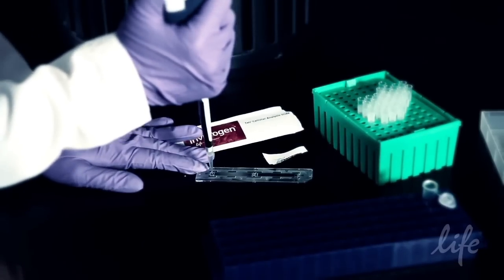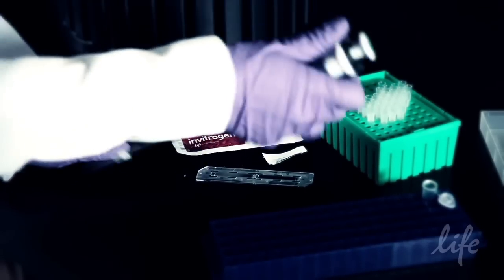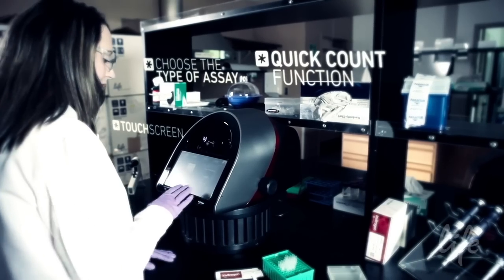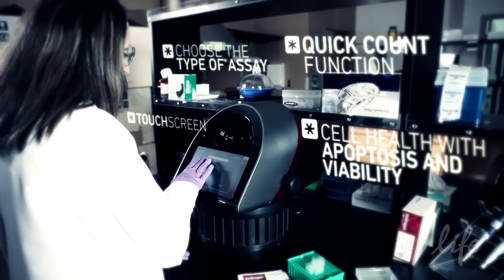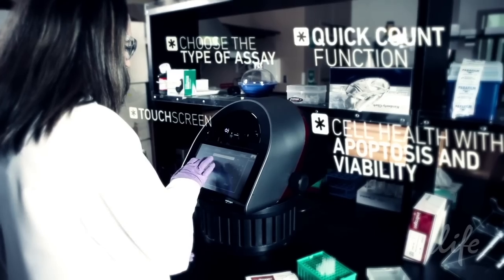Using the touch screen, choose the assay you want to run. In addition to the quick count function, TALI is preloaded with assay options for cell health, including apoptosis and viability, and cell cycle.